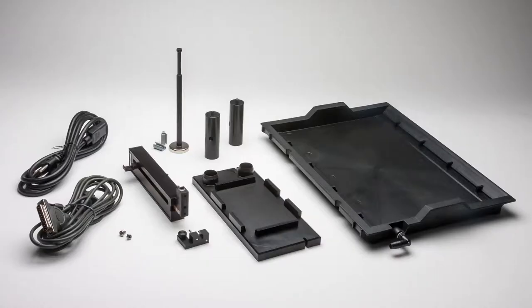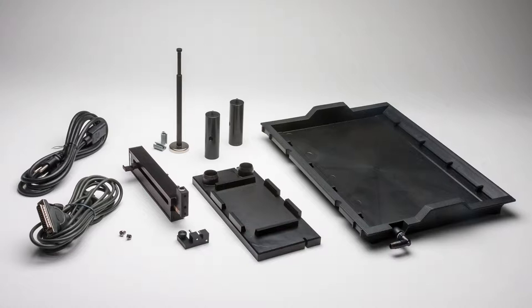Packed in the carton with your REMS robot, these are the components you'll need to set up your system. Be sure to set all the other components aside for later use.